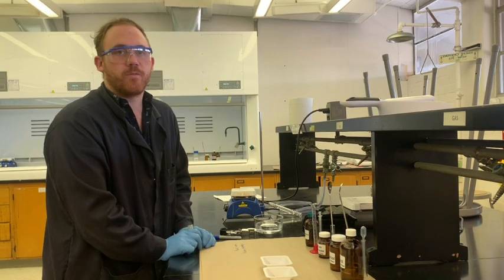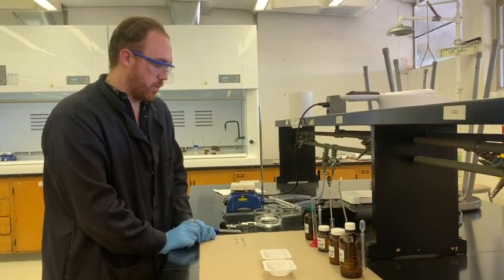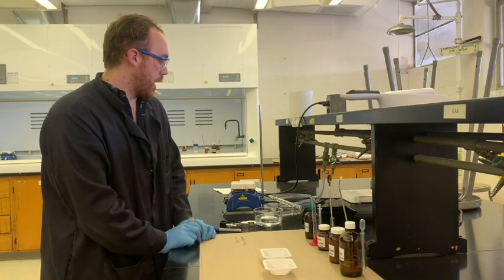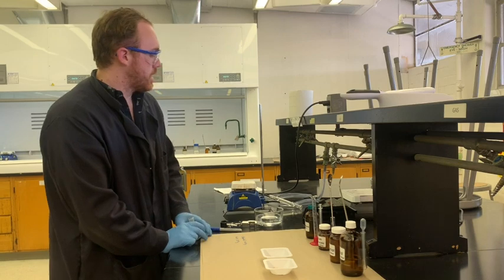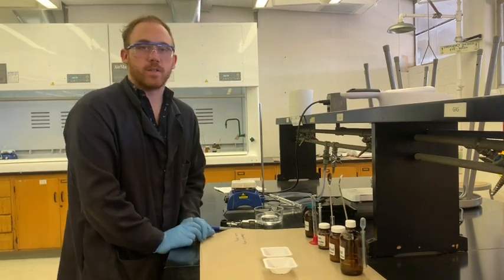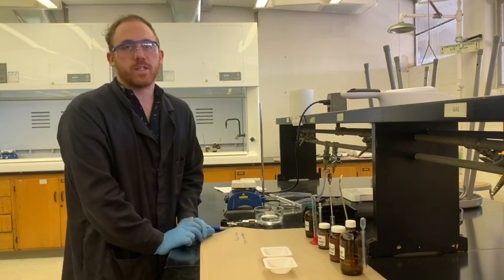Today we're working with ethanol, it should be fine. Thankfully it's not going to be running at an extremely high temperature. The boiling point of ethanol is 78 degrees Celsius, and water has a boiling point of 100 degrees Celsius.